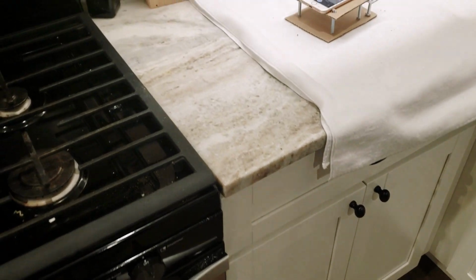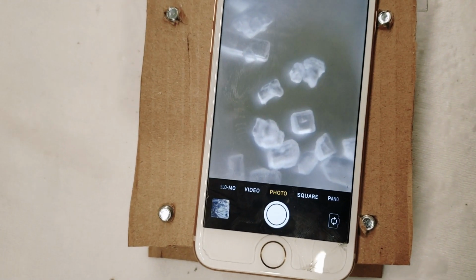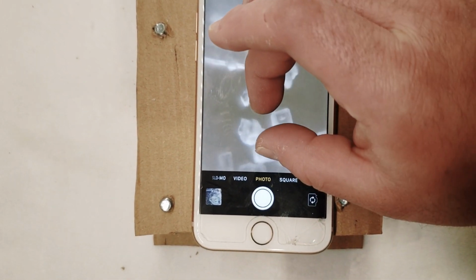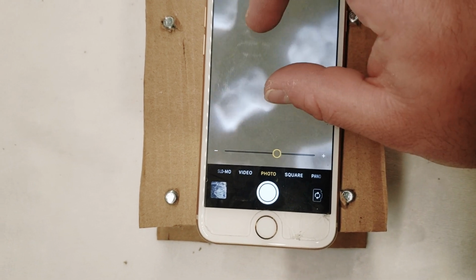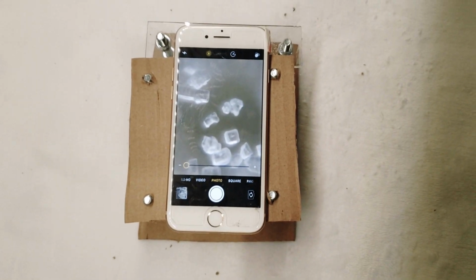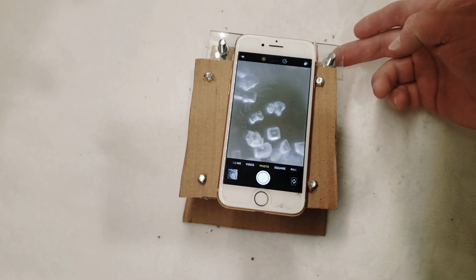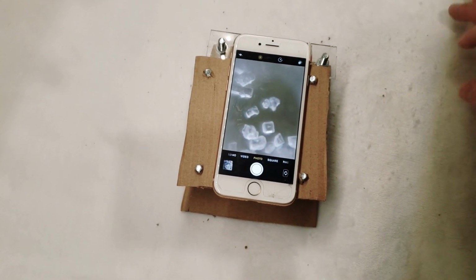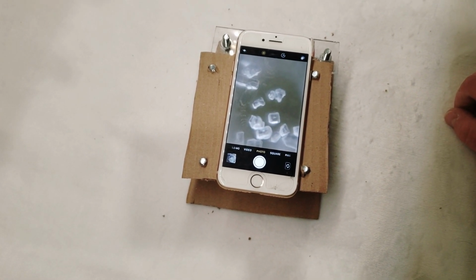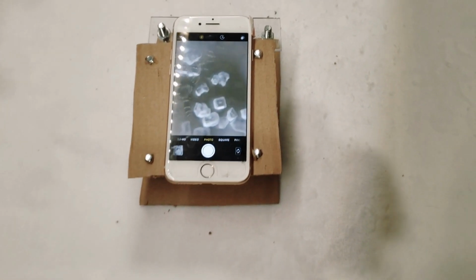We've gotten it a little bit better, so we're going to come over and see. You can see those crystals have turned up pretty nicely, and now we can even zoom in on them if we want. If you really want, you can touch that up a lot better, really hand tune it, maybe throw some wing nuts on here instead of normal nuts, just to get a little bit better control when you're trying to focus that. But yeah, that's the basics of it.